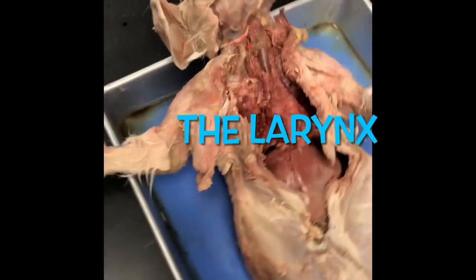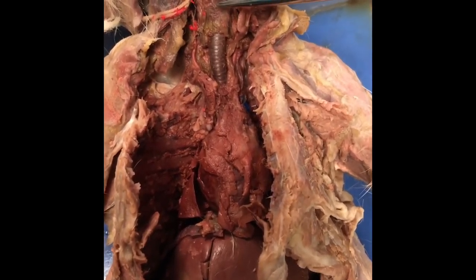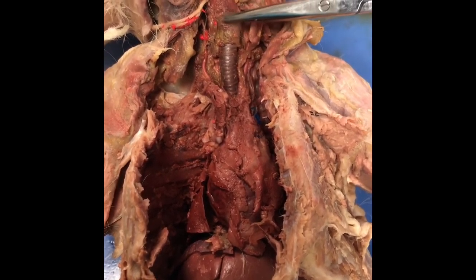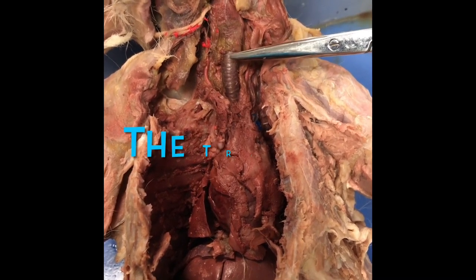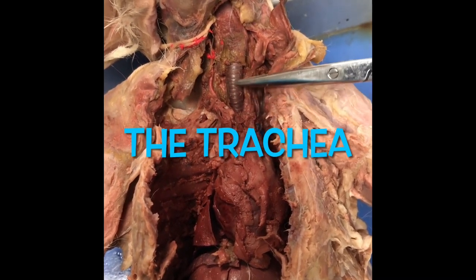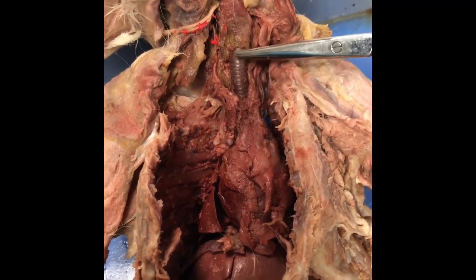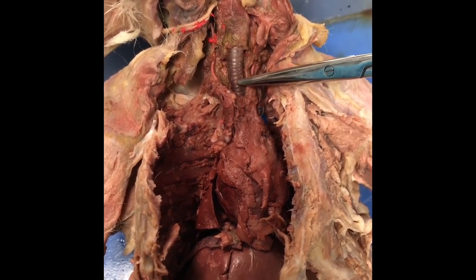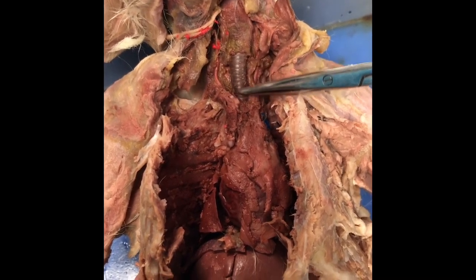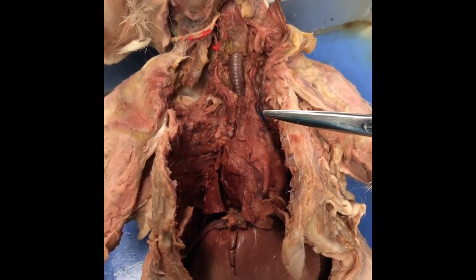Here I am pointing to the larynx at the top of the trachea, and then to the trachea itself. The tracheal rings are those C-shaped rings that maintain the shape of the trachea, so they feel like little railroad tracks as you go across the trachea.